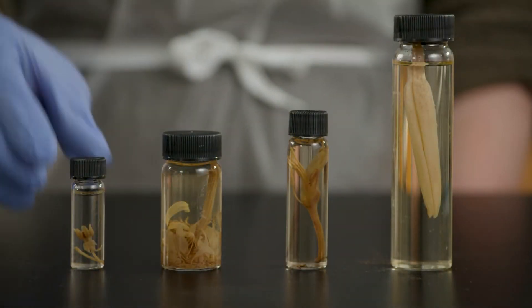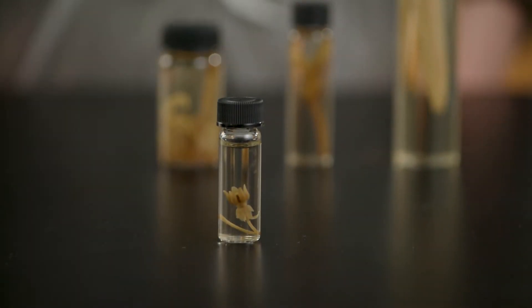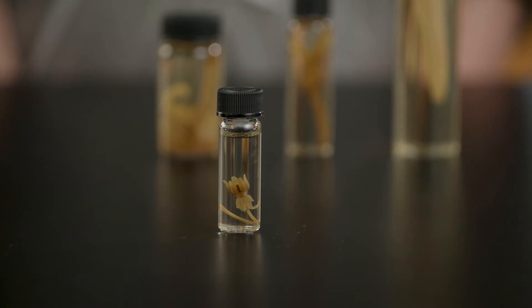The milkweed flower is the smallest of the specimens in the investigation. It is very delicate and may be difficult to remove from its container intact. Do not be alarmed if you do not remove the specimen in one piece.